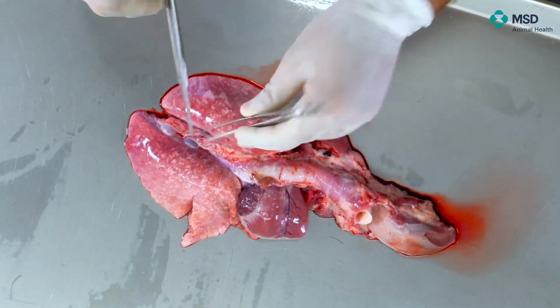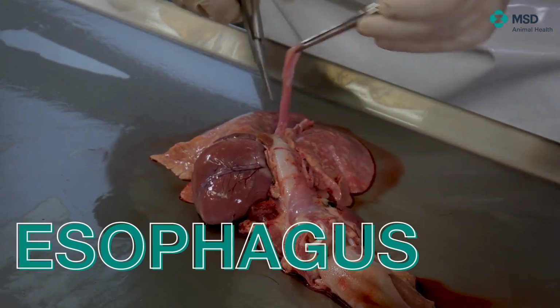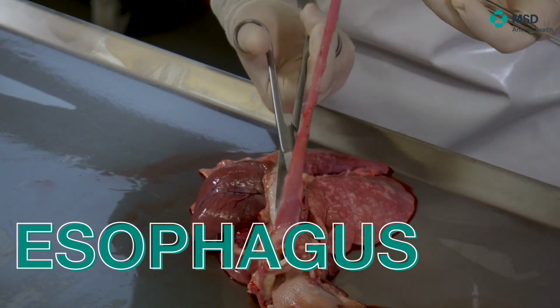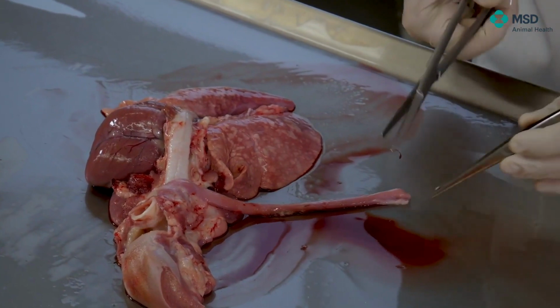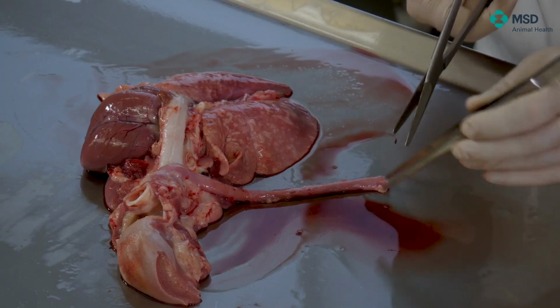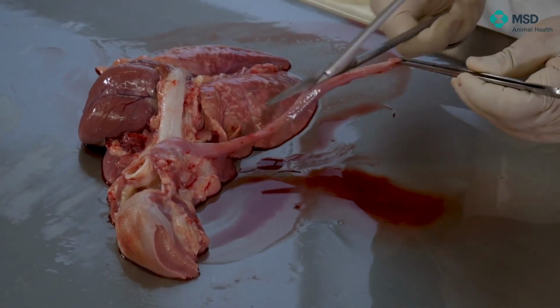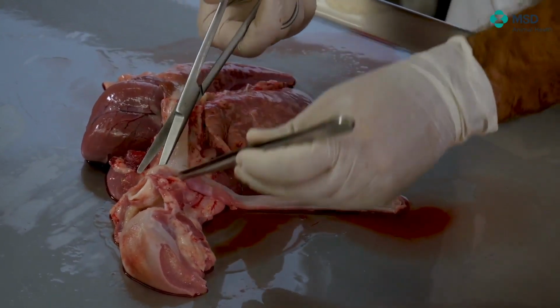Secondly, we want to study everything in here. This means that we have the esophagus. So what we will do first is to separate the esophagus. As you can see, I'm doing it carefully. We have the esophagus at this part together with the aorta, but look that I'm just separating it. And then I will open it longitudinally, because at the very end in the esophagus is not expected to find any special problem, but it's always interesting to be sure that at least it's normal.